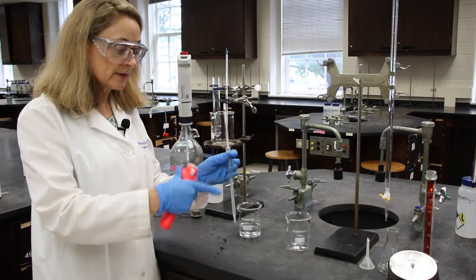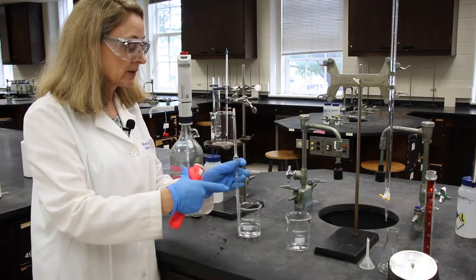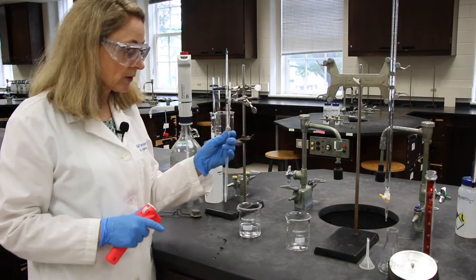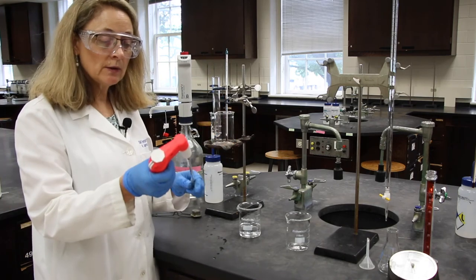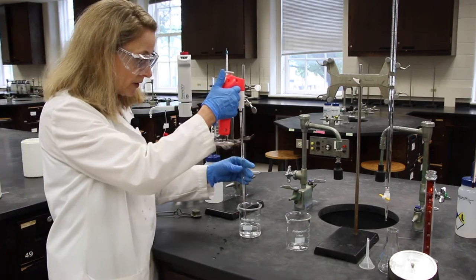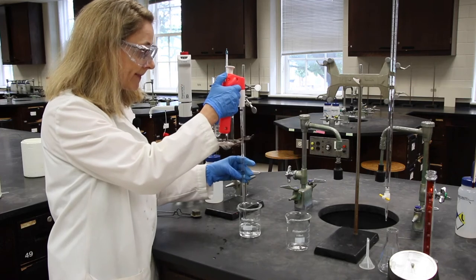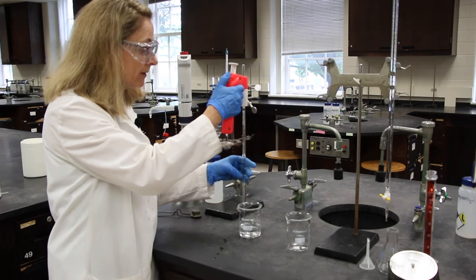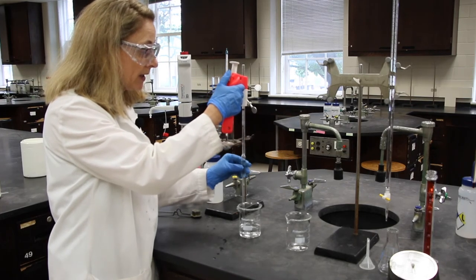And that means rinsing the surface, the inside surface of the pipette with the solution we're going to be using. And how we do that is you'll just draw up liquid above the marking on the barrel.